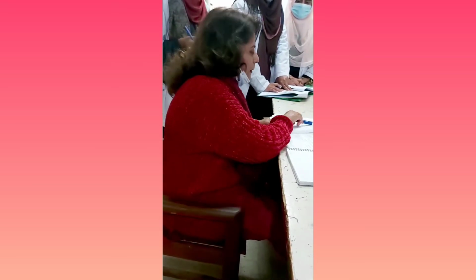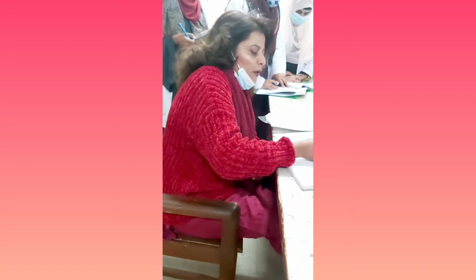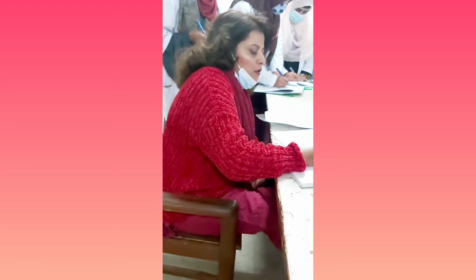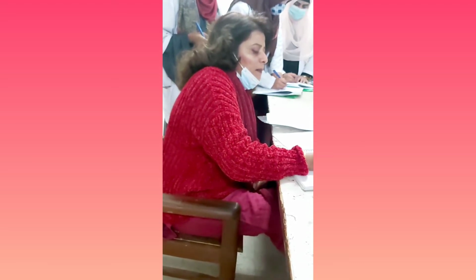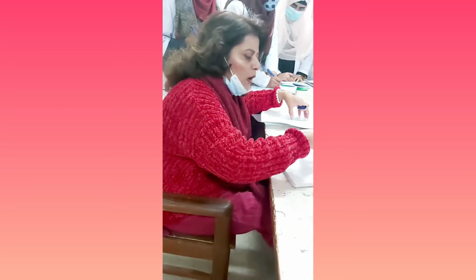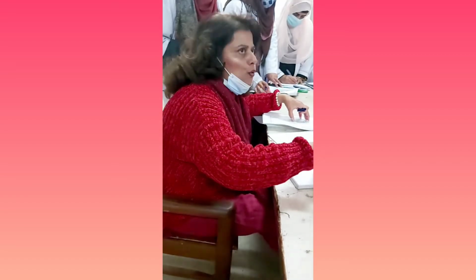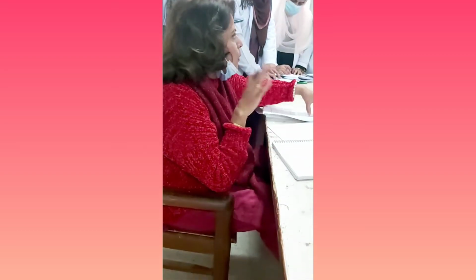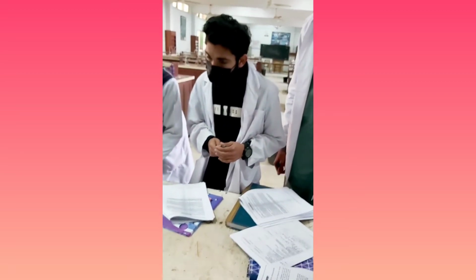Now here there is a procedure, that is, preparation of Lassaigne's filtrate. So you are going to write down the heading, preparation of Lassaigne's filtrate or sodium extract, right? Keep in mind that this procedure is given and written here. You have to write it down in your journal as it is. Don't use your own English, okay? Use the English that is here. Just write down this method only. Don't write the introduction. Whatever I'm telling you, I'm not going to repeat again. Listen to me for once, okay? You are very good and very nice students, and I'm very happy that you've been doing things very nicely.